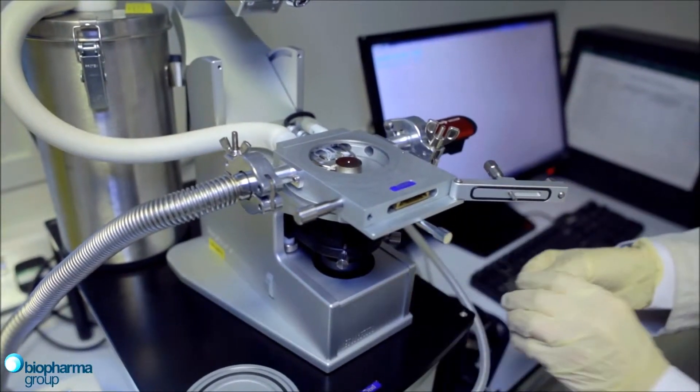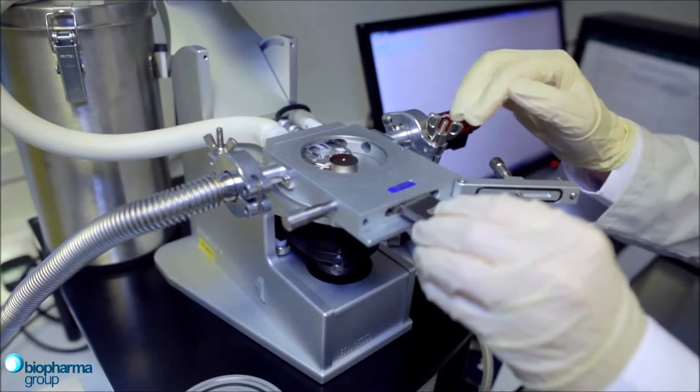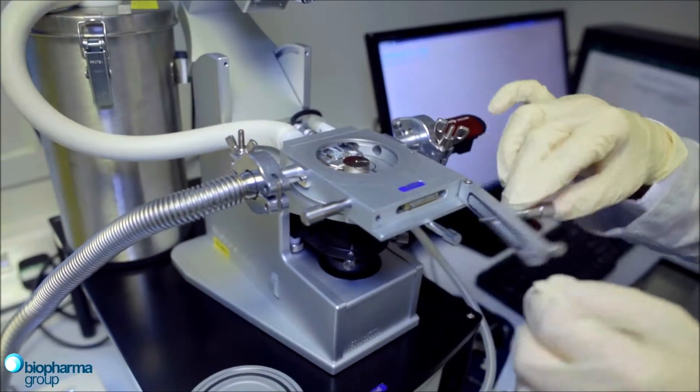If you haven't done so already, unscrew the front and load in the XY manipulator ring and secure.